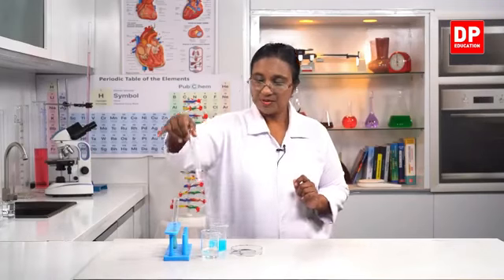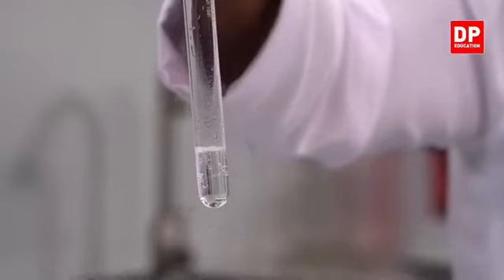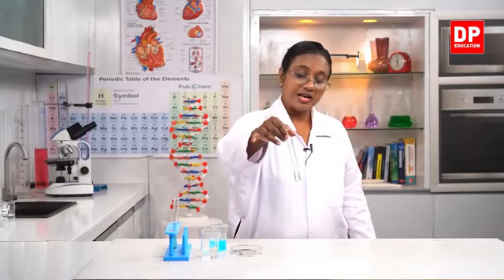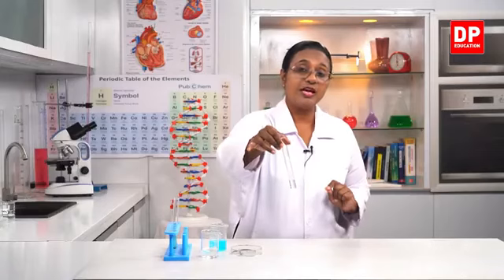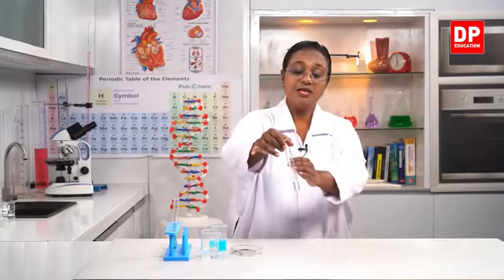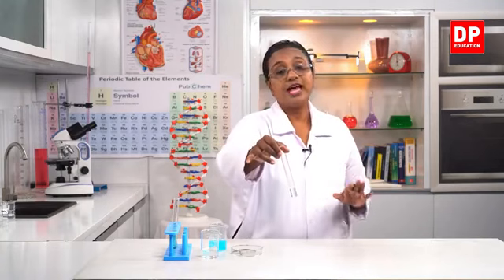The same way I told you all, now in this also, you can see at the top a very tiny piece of magnesium. I put a small piece of magnesium into hydrochloric acid. You were able to observe the liberation of hydrogen gas, and still the magnesium is reacting. So there are magnesium plus hydrochloric acid, those are the reactants. Magnesium displaces hydrogen. That is why hydrogen gas is evolved, and in the solution it will be magnesium chloride that remains.